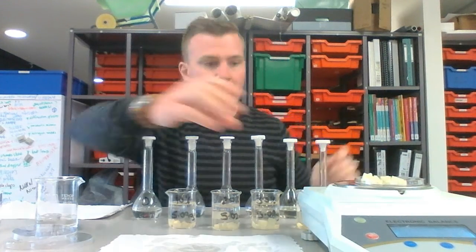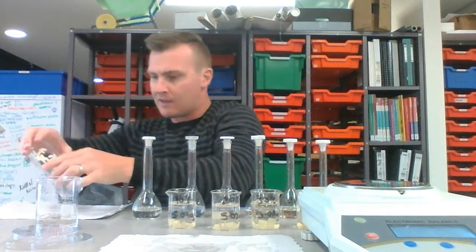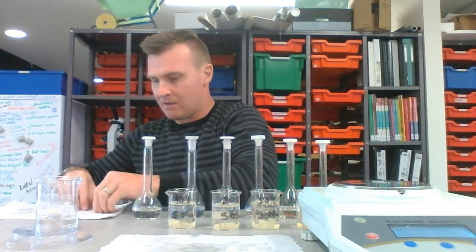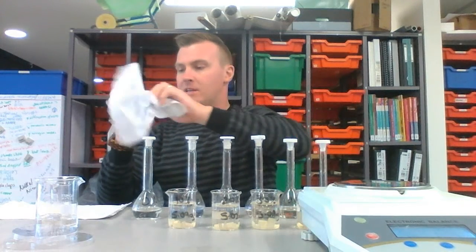5.87. Okay, and I'll put those back into the beaker. I don't really need those for anything else, but save the packing up for later. So get my Petri dish wiped.